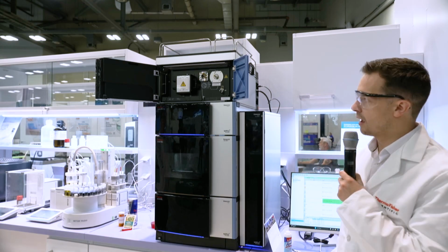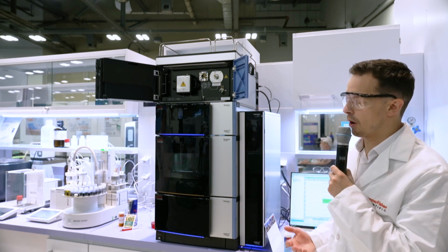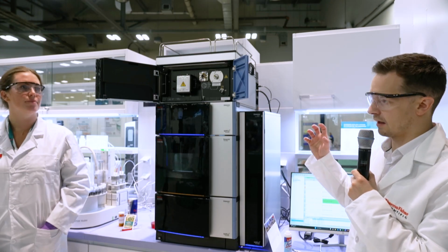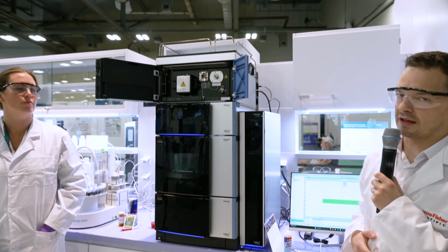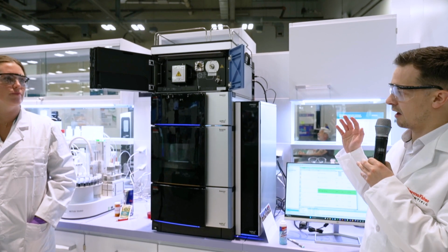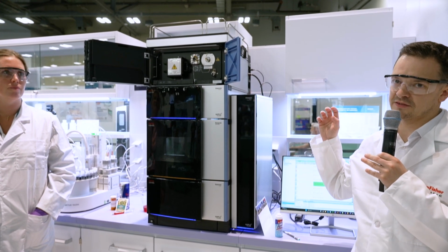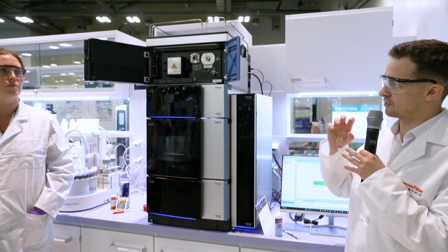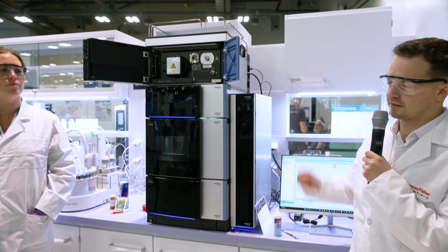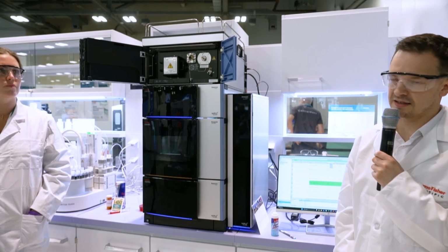an evaporation tube, and that evaporation tube is there to remove all the volatile compounds, so essentially the mobile phase. Once it's passed through that evaporation tube and all the volatiles have been evaporated off, it then goes into a mixing chamber. In that mixing chamber, we're firing charged nitrogen gas at the particles that have been formed. And this charge, when it collides with the particles, forms around the particles, and then that passes through an electrometer, and we measure the size of the charge that's been applied to the particles. And then that gives us our detector signal.